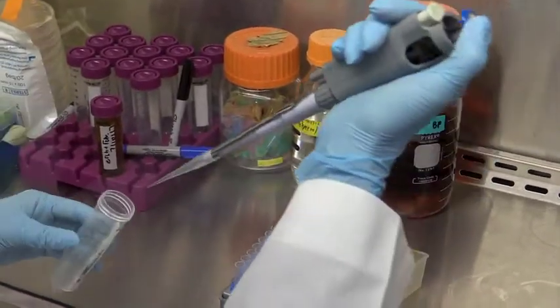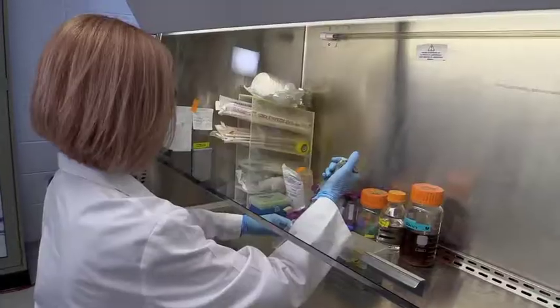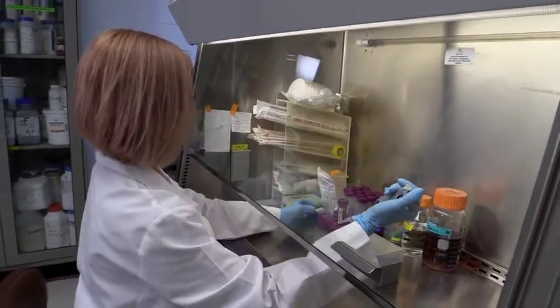Well, a biosafety level 1 lab, for example, would be appropriate for use with materials or biological agents that wouldn't necessarily pose a risk to human, plant, or animal health. Okay. Something like a non-pathogenic E. coli strain, for example. Okay. Now, when you start to move up and work with materials that come with a higher potential risk, you want to work with them at higher biosafety levels. So a pathogenic E. coli strain, for example, you'd want to work with at a biosafety level 2. That also would apply for HIV or hepatitis B. These are agents that cause disease for which we have treatments.